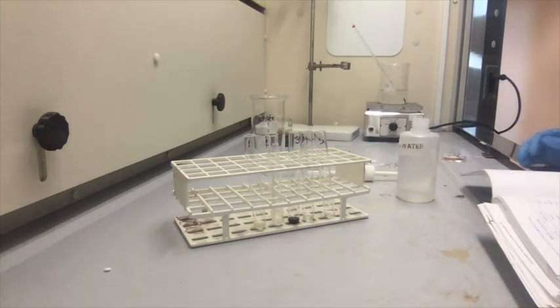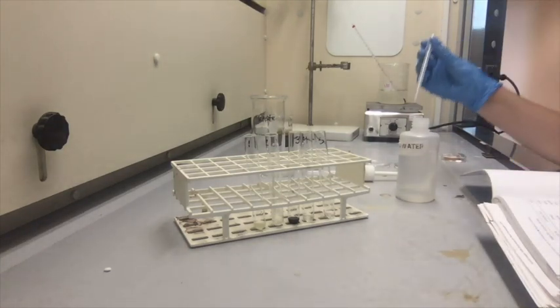Wait a few more seconds for those to cool down a little bit before we pipette this in there.